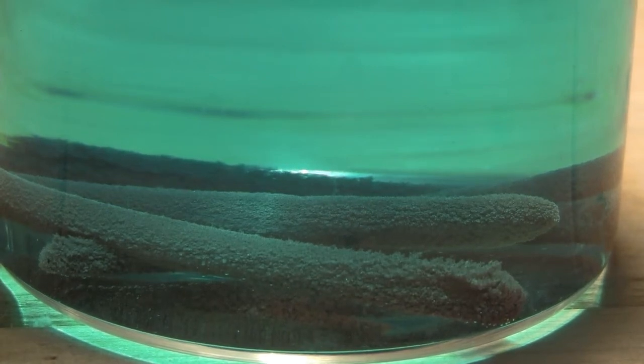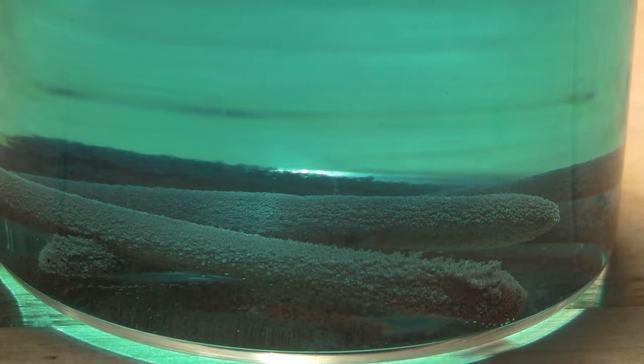Today I'll be preparing copper powder from weed killer. Copper is an orange-brown metal that finds a lot of use in metallurgy, electronics, and chemistry.